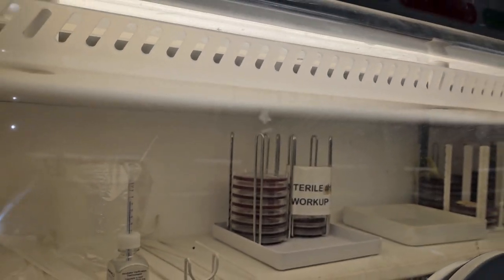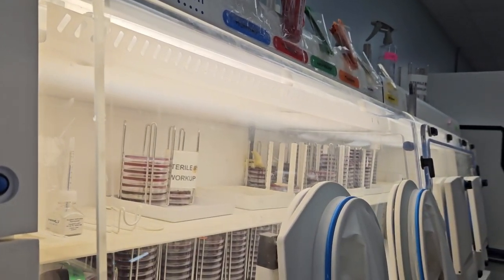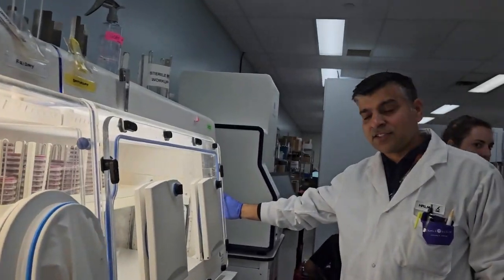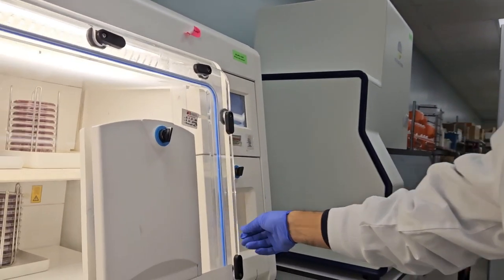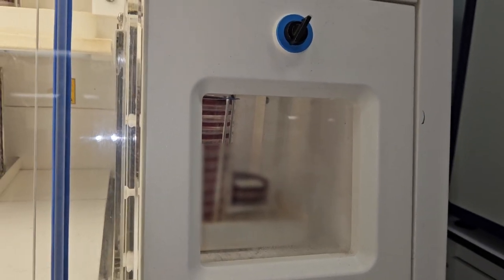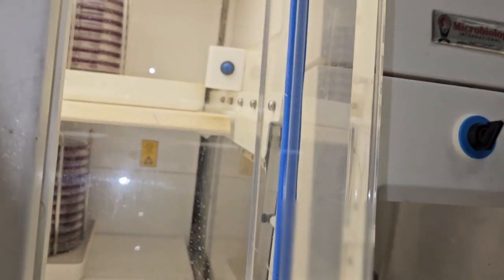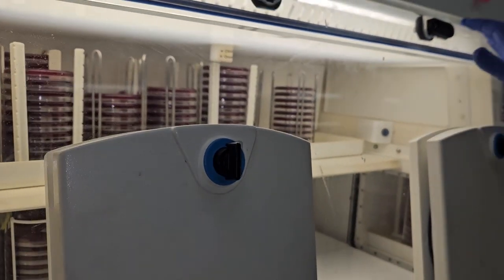On day one, we load the plates on this side. This is the access door. We can load our plates inside there, which keeps anaerobic. Once it is in, we have to move them into the body where there is actual 37 degrees Celsius.